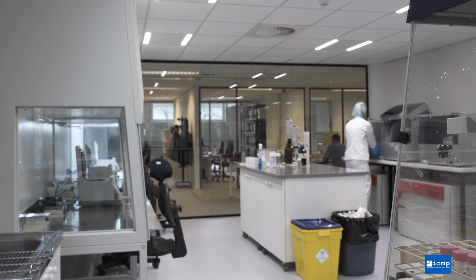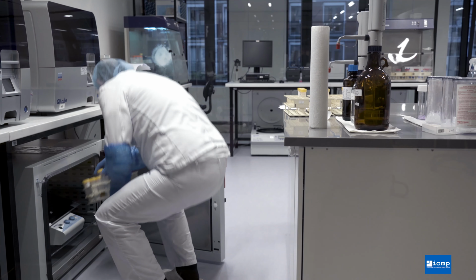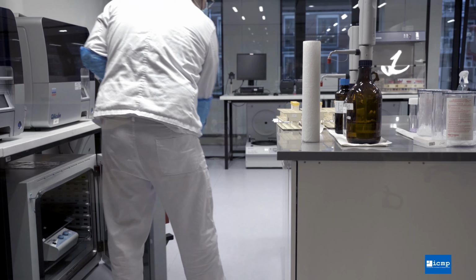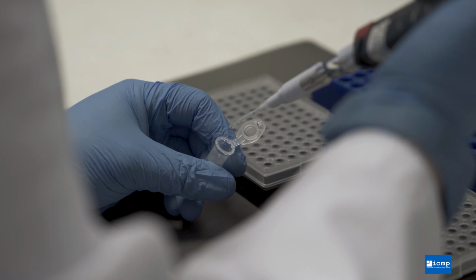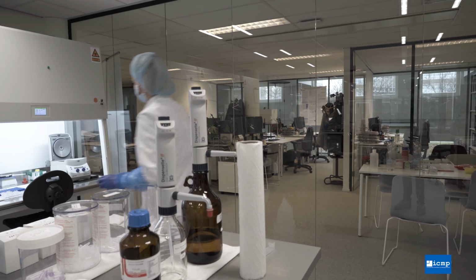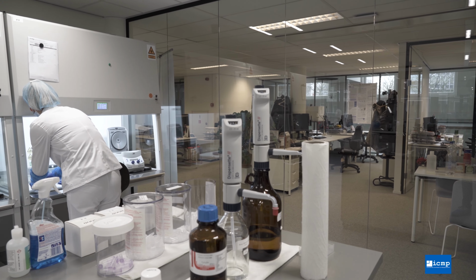The ICMP DNA Laboratory provides the capability for the ICMP to offer large-scale DNA-led human identification services in support of the identification of missing persons. The ICMP is the only international organization exclusively tasked with accounting for missing persons. The DNA Laboratory supports the work to identify those who are missing as a result of conflict, such as in Iraq, organized crime, mass disasters, irregular migration, and other causes.